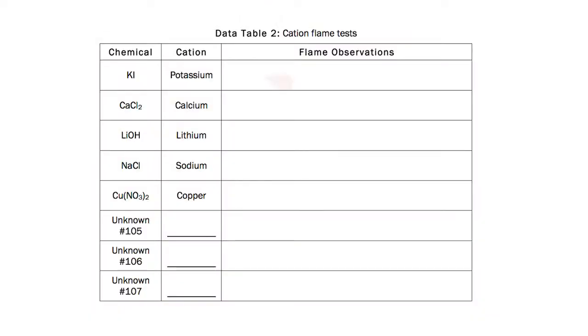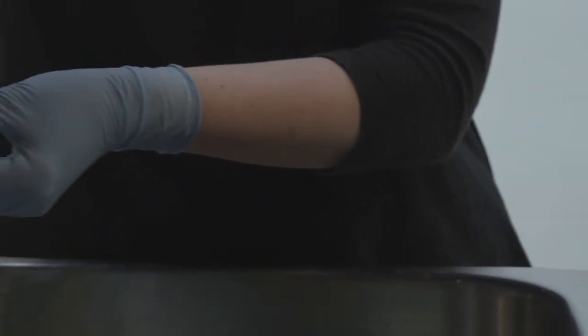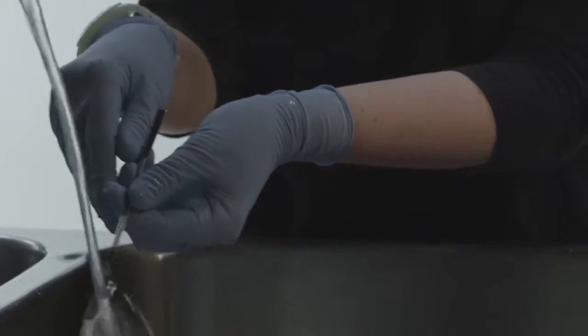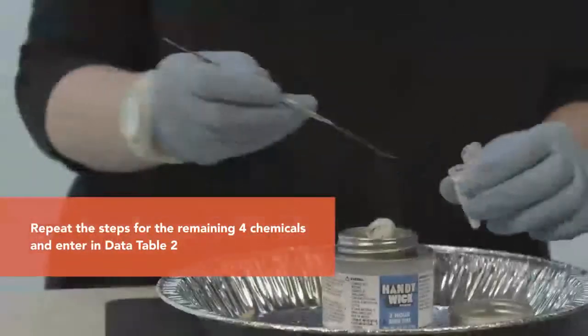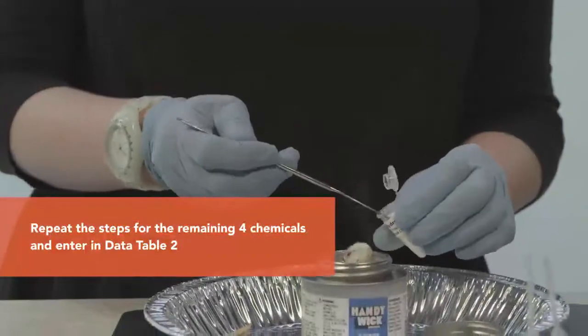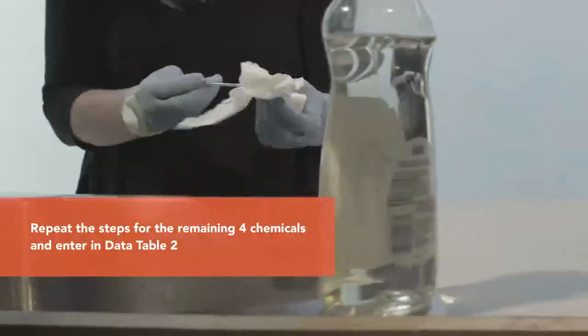Record the observations and the color of the flame when reacting with the cation in Data Table 2. When the observations are complete, pull the spatula away from the flame and allow the spatula to cool for 1 to 2 minutes. Rinse the spatula with water to remove the chemical residue and dry the spatula with a paper towel. Repeat the steps for the remaining 4 chemicals in Data Table 2. Do not yet perform the cation flame test on the unknowns.